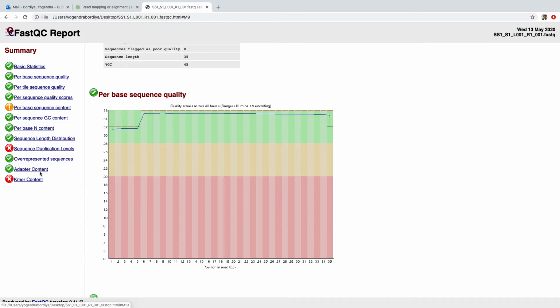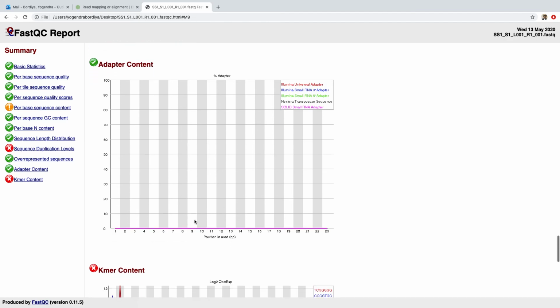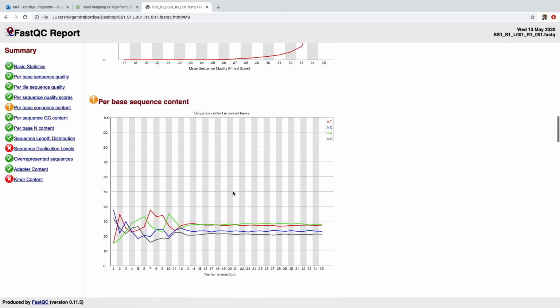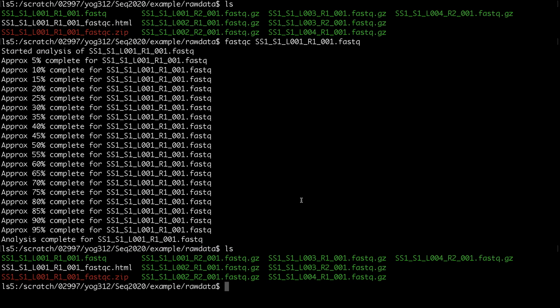Some of other important summary statistics here is the sequence duplication level or overrepresented sequence. A lot of times, overrepresented sequences contain adapters from, say, Illumina or Nextera, any adapter that is actually from the library. Those adapters need to be removed before you can map your sequence on the genome or do the de novo assembly. So you can Google any of these statistics and find out more about what each of them mean. But this is how you can do a basic quality control on your fastq file.